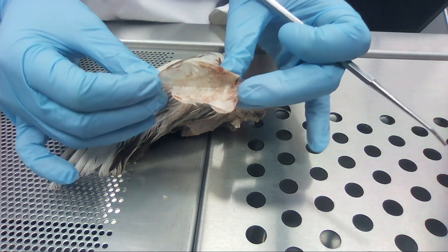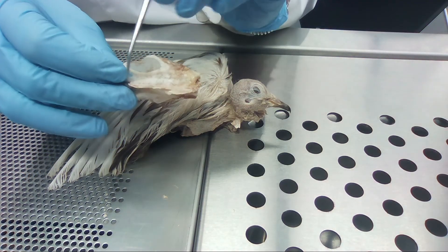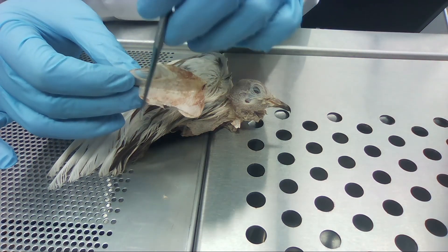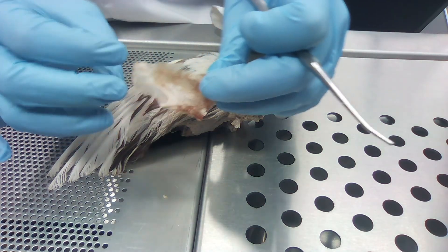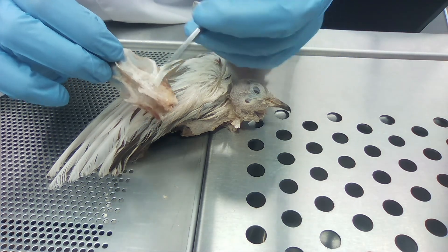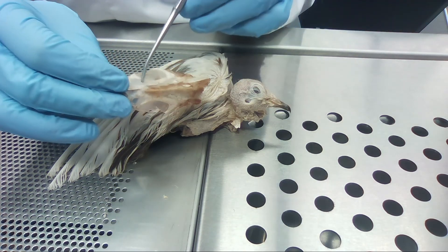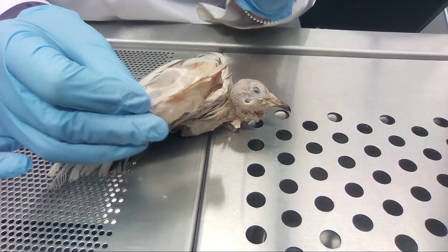What we have right here — we already took out — is his breastbone, and it's keel-shaped, which means it's kind of shaped like a boat. These on either side are their ribs, they're fused together, and these are just little projections on the base of his breastbone.